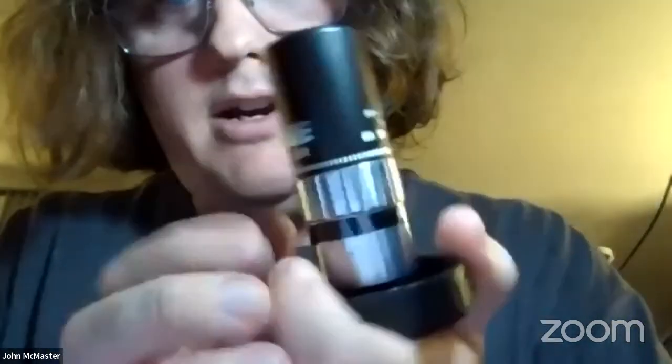Yeah. I was going to say I can actually demonstrate because I have such a system here. Let me grab a few from my magical tray here. So here is a Mitutoyo NIR objective.